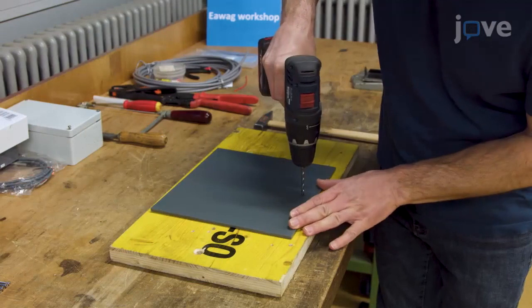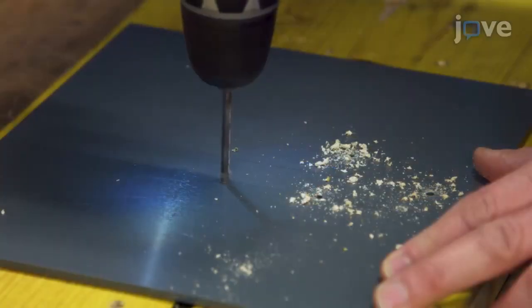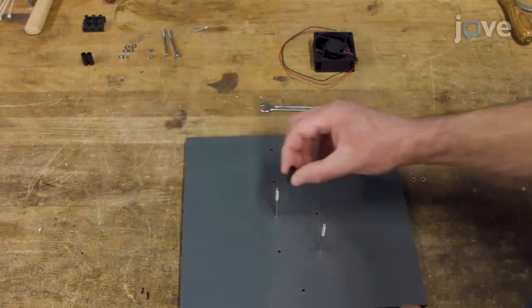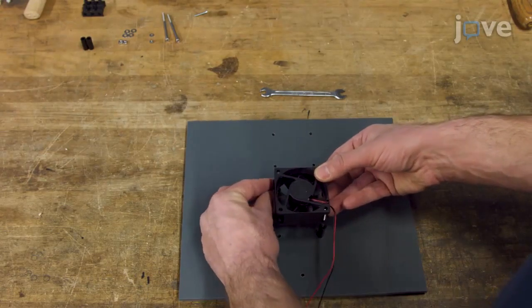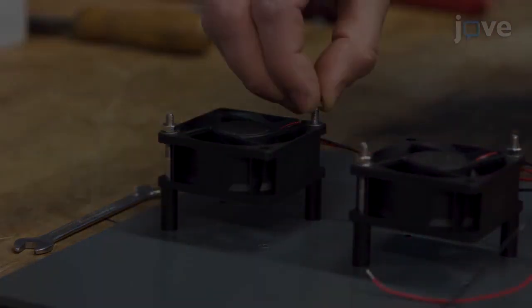Next, drill the appropriate anchorage holes into the support plate for securing the axial fans and the luster terminal. When all of the holes have been drilled, use 2 M4 screws, 2 screw nuts, and 4 washers per fan to anchor the axial fans in the center of the support plate, using the spacers to maintain space between the fans and the support plate.